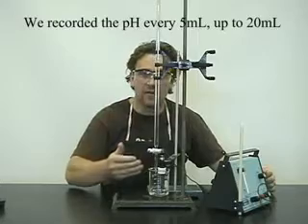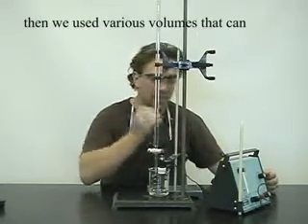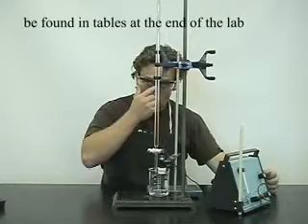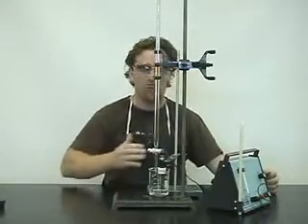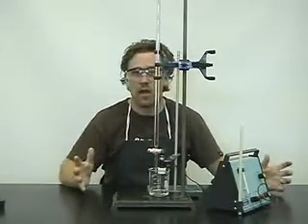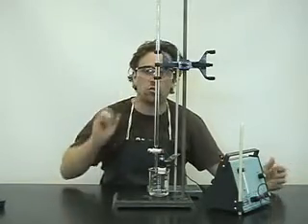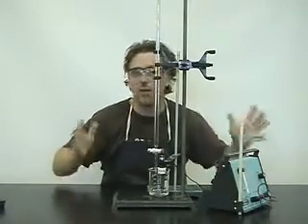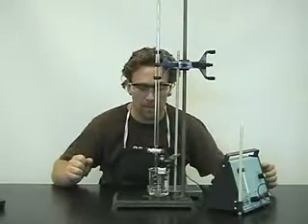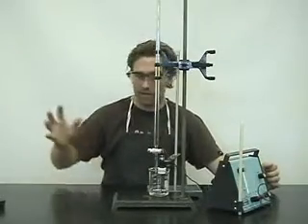Add five mils, take the pH. We're going to do it approximately until we get to a pH of near 13. In other words, the pH of a strong base, somewhere between 12 and 14. That's going to be our finish point.